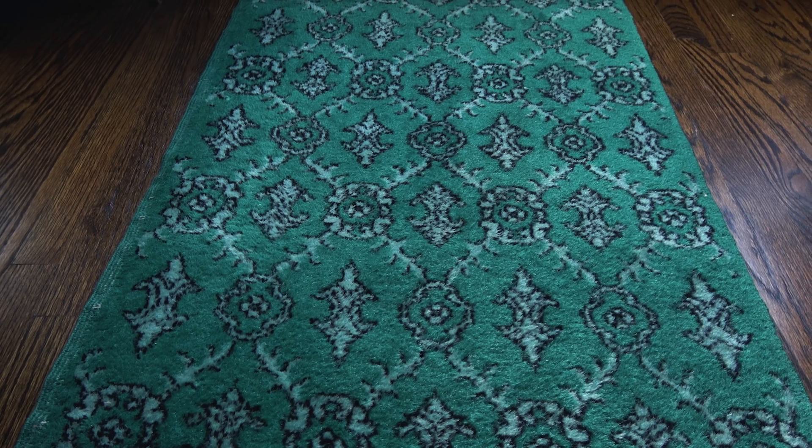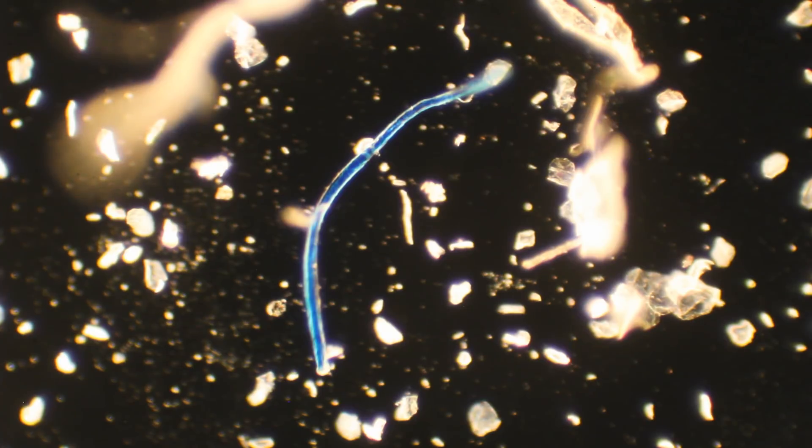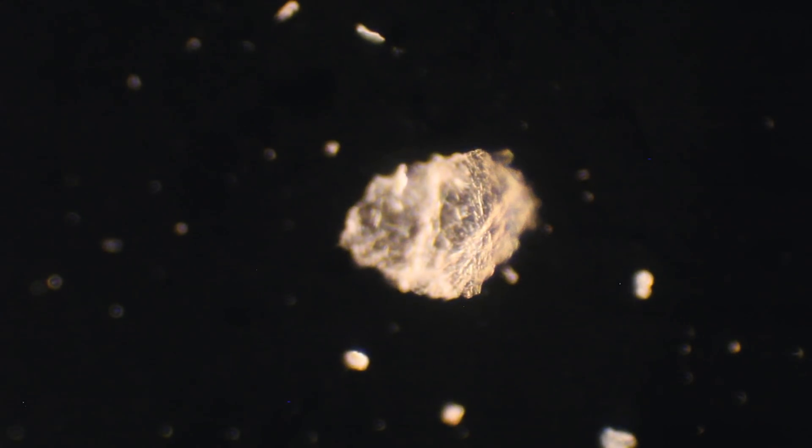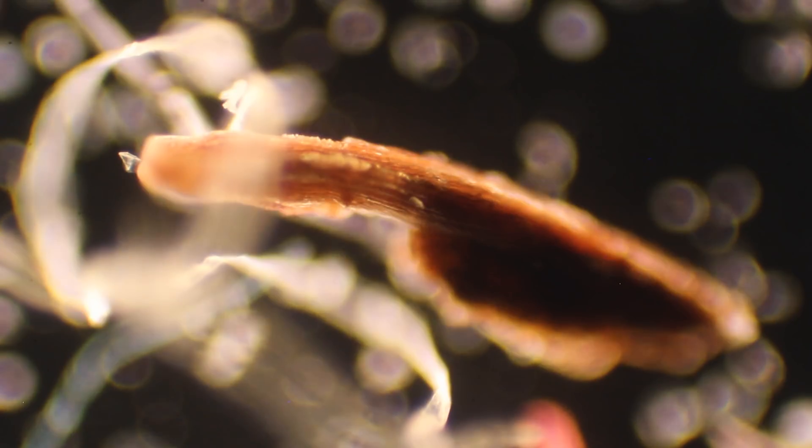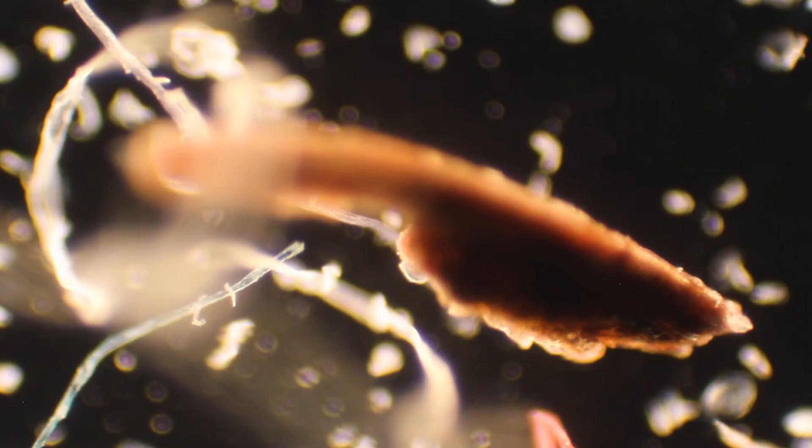A green fiber from my grandfather's rug. A blue thread from my winter jacket. A beautiful shard, which is probably my dandruff. A speck of red wool from a hat that my mom knitted 30 years ago. And there is one type of dust I cannot show you under the microscope: space dust, which is on average the size of between a stone and an SUV. In fact, the whole history of humankind and all the beings we have discovered so far are placed on a giant dust bunny.